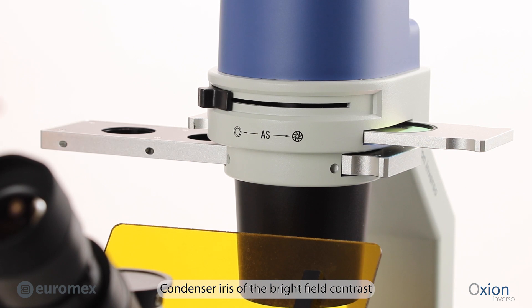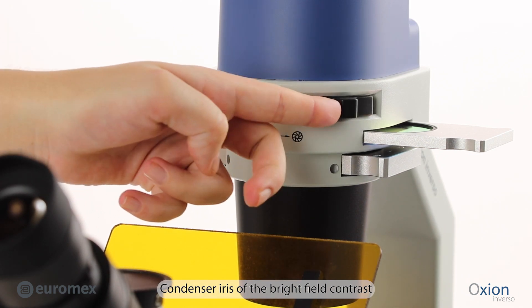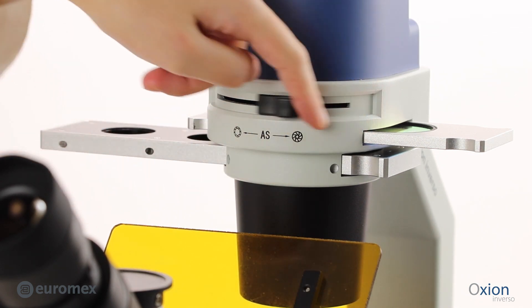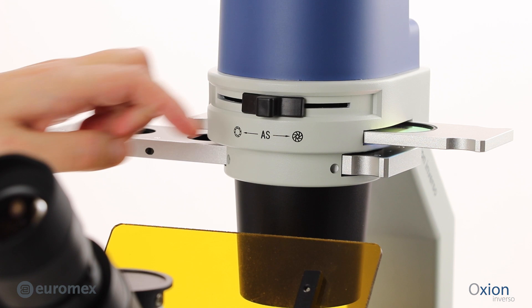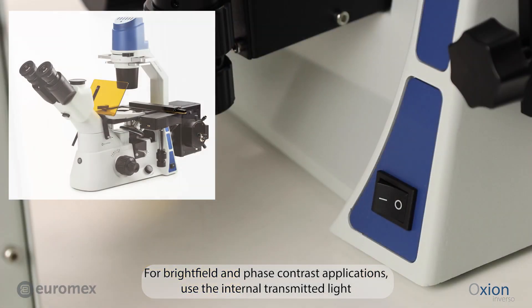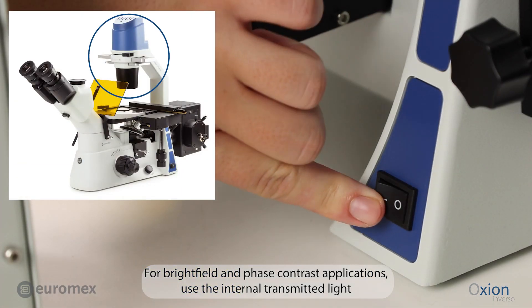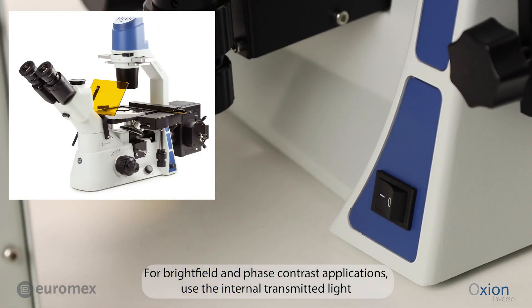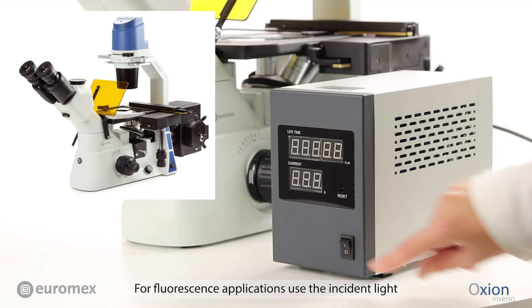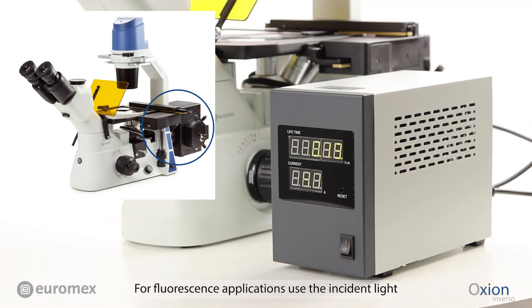Condenser Iris of the Brightfield Contrast. For Brightfield and Phase Contrast Applications, use the Internal Transmitted Light. For Fluorescence Applications, use the Incident Light.